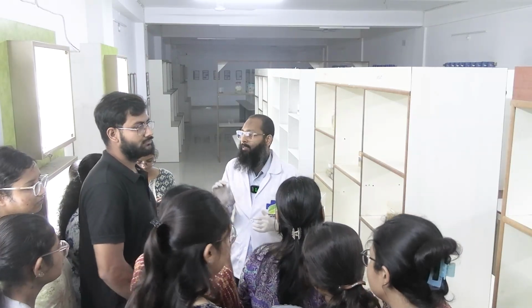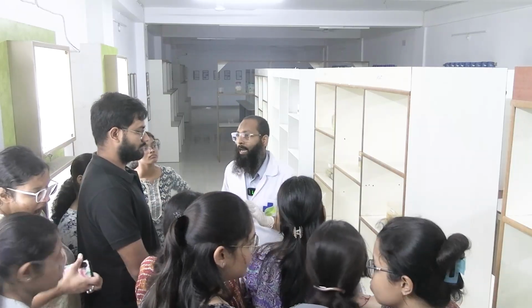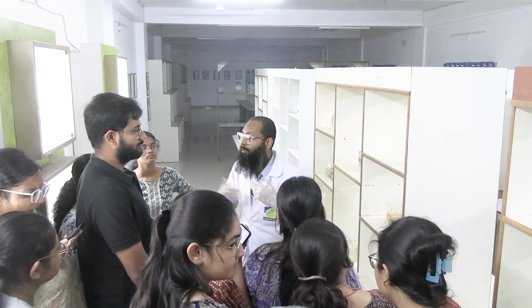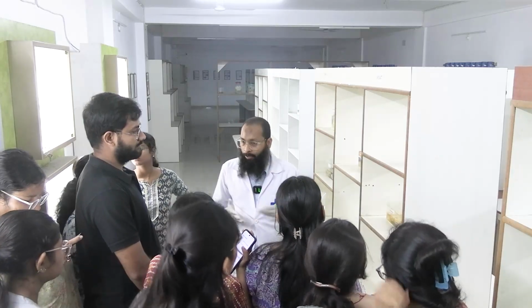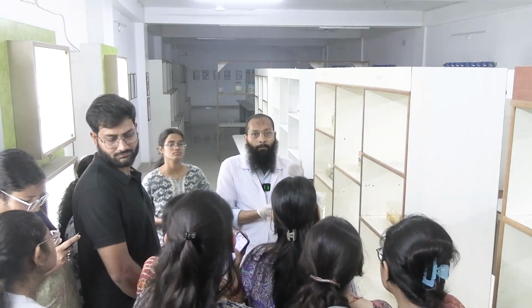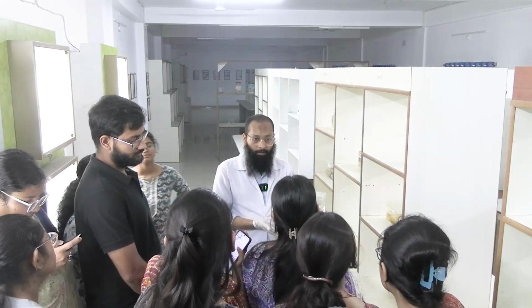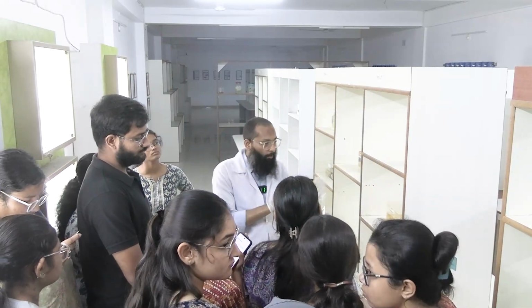After that there is a definite chance that changes will start occurring and the findings will get lost. The purpose of taking the tissue biopsy was microscopic examination, and if I can't get the microscopic properly, then what is the use of doing the biopsy? So that is the cold ischemia time.